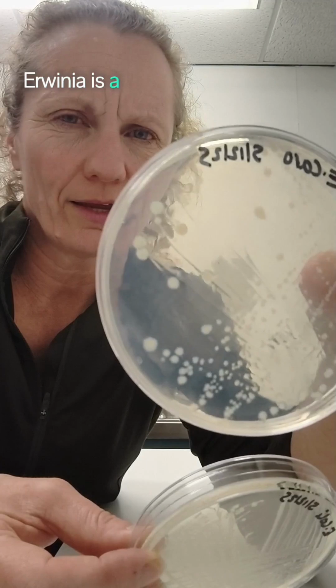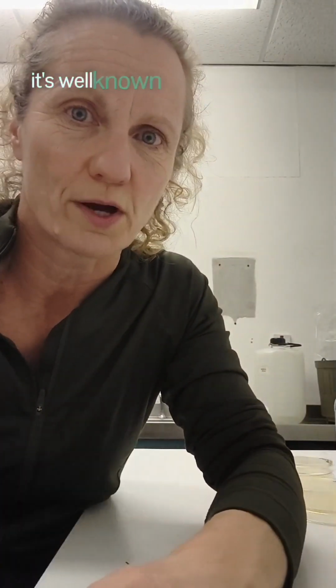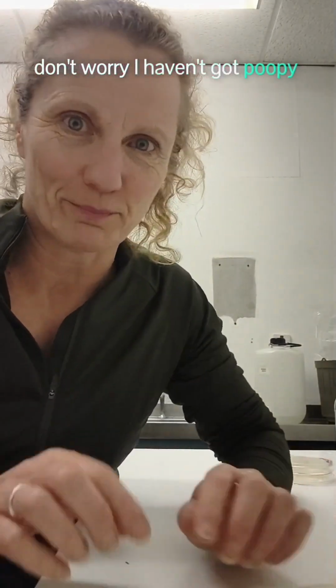Erwinia is a vegetable pathogen. E. coli is that bacterium you might have heard of. It's well known for being in poop, but that one is a safe one, don't worry. I haven't got poopy germs in front of me here.